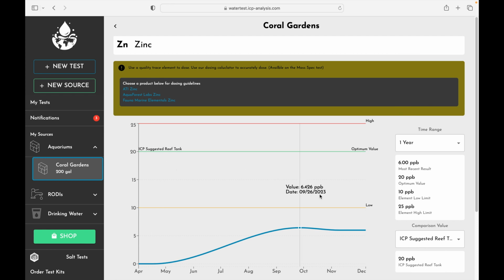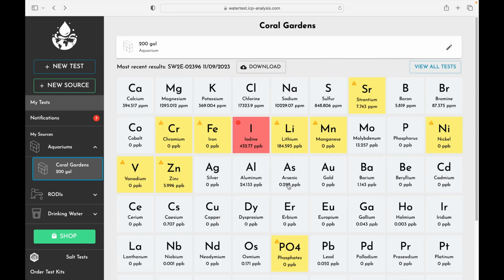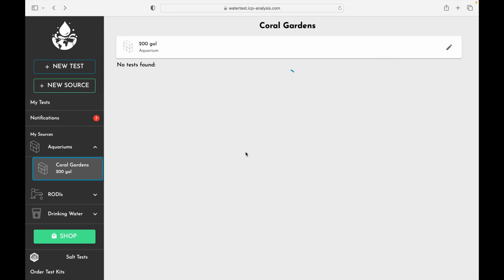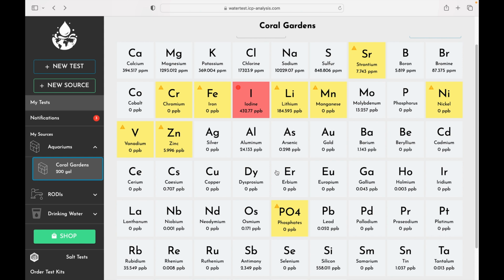And zinc here, we're also low. We're not 0, but we're low. So we have a bunch of things that are low. Lithium, we're also low with lithium. Alright, let that load here again.